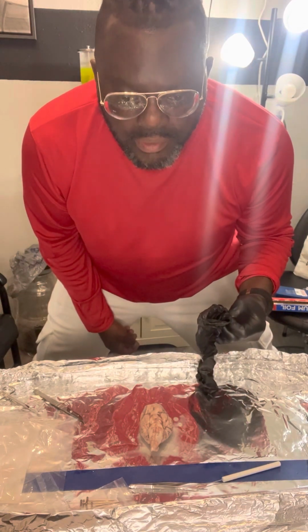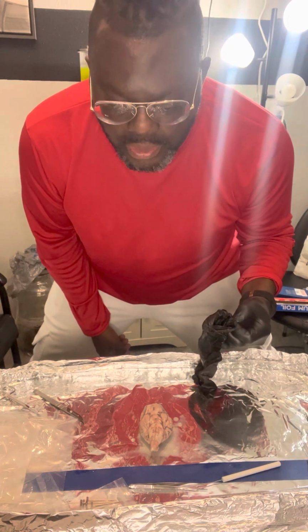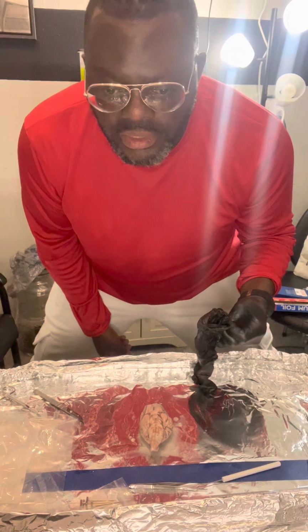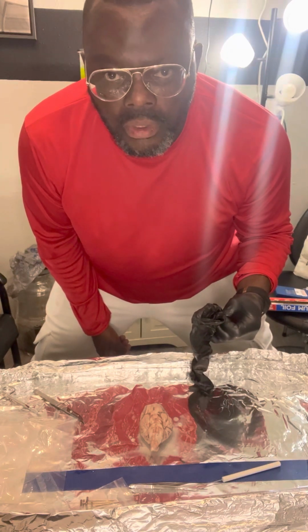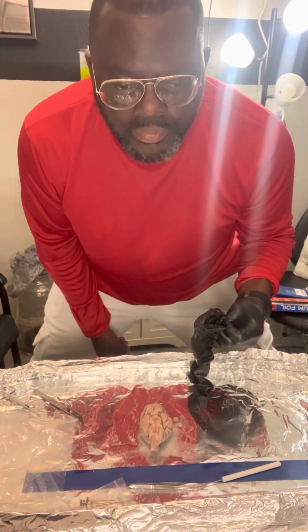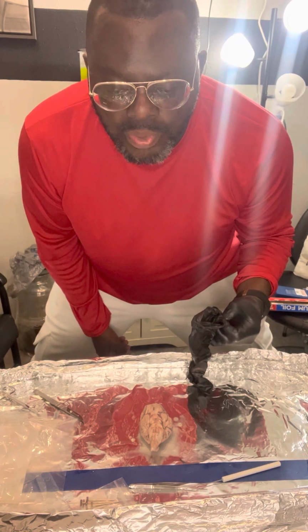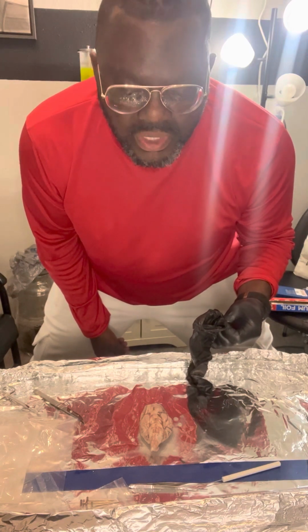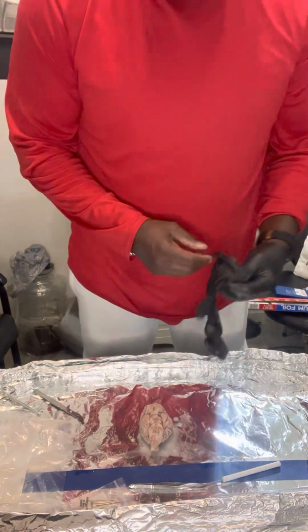And today I will be dissecting a sheep's brain. I was fortunate enough to get my hands on one, and I will be identifying 15 critical components. I will be identifying 15 points and explaining them in some form of detail, what they are, what their functionality is. As you can see, I am gloving up.